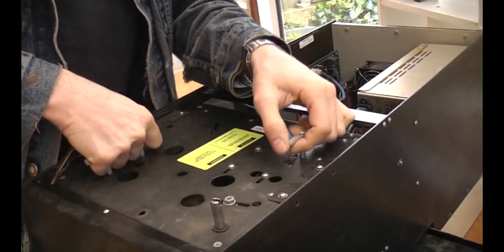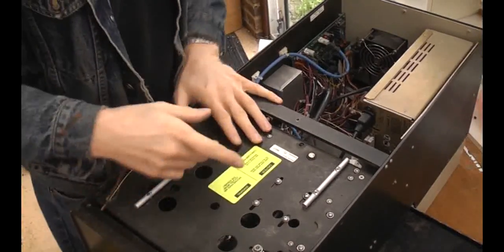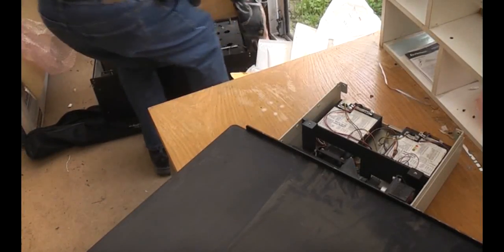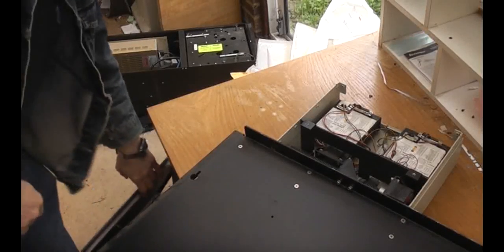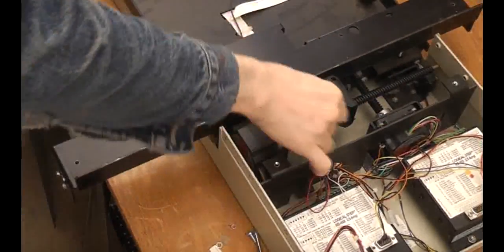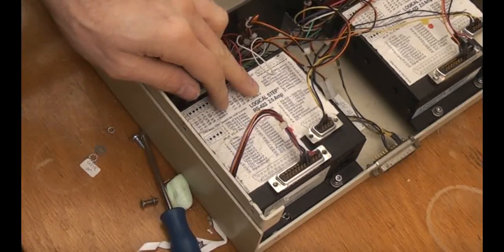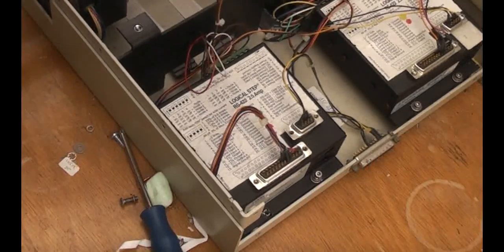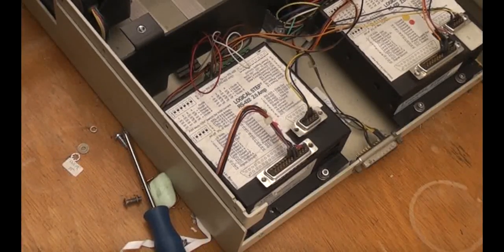I can unplug this and the whole lot will come out in one piece. The XY table is a separate piece. I've taken all the screws out and the assembly does lift off. Now I've just got the XY table. We've got two stepper motors, X and Y, and just two off-the-shelf stepper drivers. They're RS422, so these have their own dedicated connector - that probably goes off to an interface card on the PC to drive the motors. The only connection to the main unit is a power connection. There are limit switches on the ends and that's pretty much all there is.